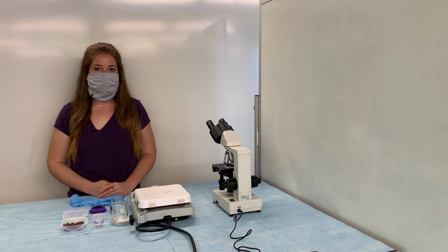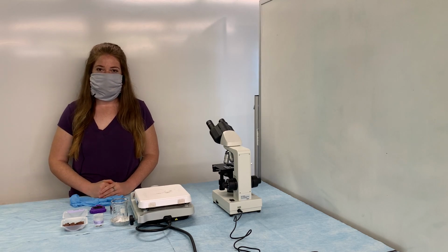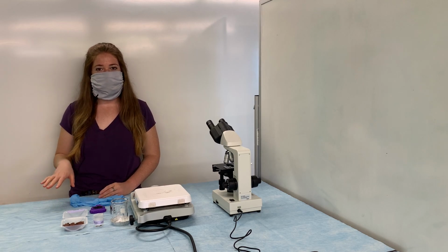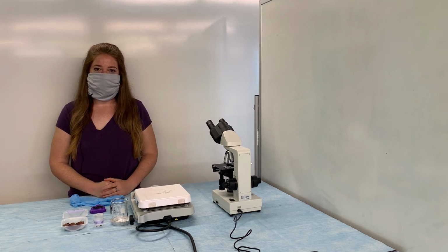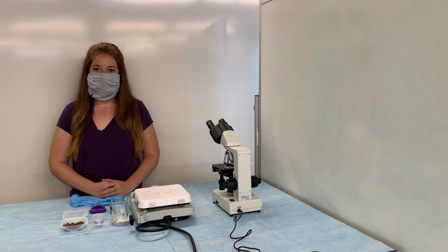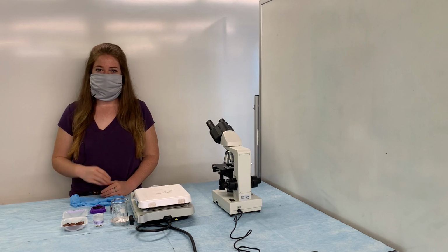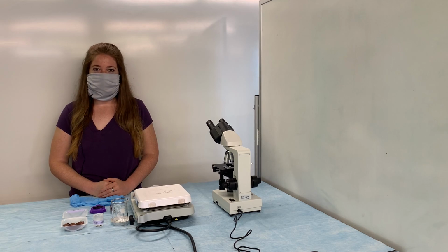So once it comes to a boil, we're going to allow it to boil for a total of 2.5 minutes, and then I'll be removing a drop and placing it on a slide for us to view under the microscope. While we're viewing that initial slide, I'm going to continue to let our mixture boil for another 1.5 minutes, so 4 minutes total. Then I'll remove another drop and place it on a secondary slide for viewing under the microscope. This will allow us to determine if the heating time affects the microspheres. So let's get started.